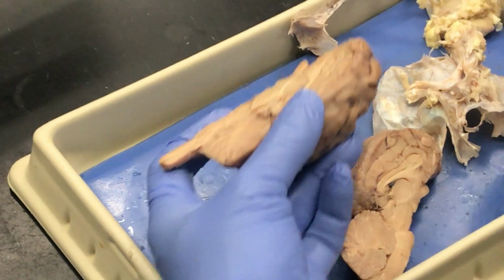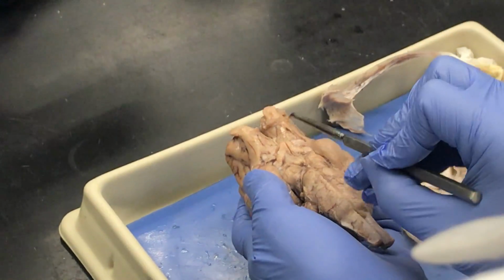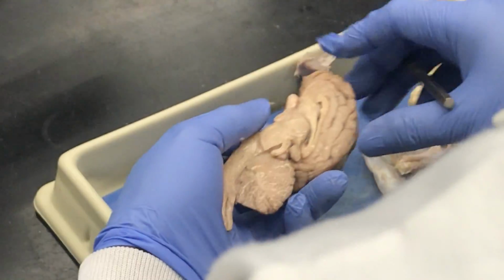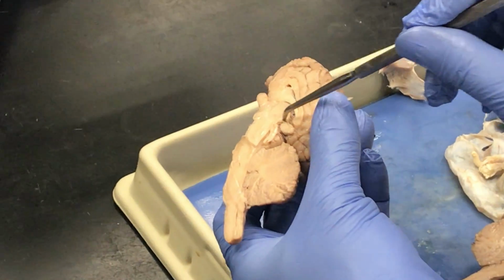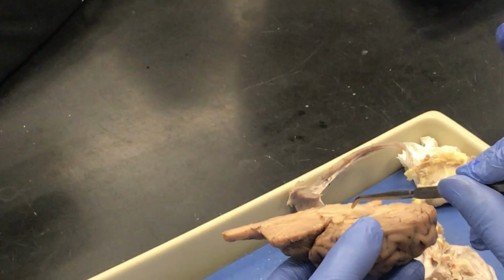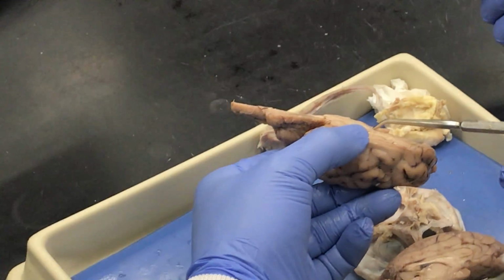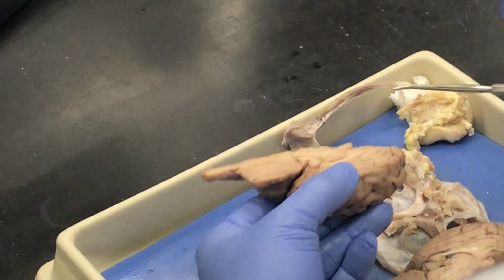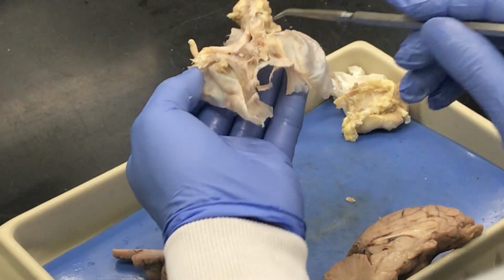Hypothalamus. So something else you could look for. Here's just the other portion of the optic chiasm. So when you split it in half, hanging off here is optic chiasm. You have the circular area of the thalamus, and hypothalamus is right between those two. Okay? So the circular area is thalamus, optic chiasm, and hypothalamus is right here between those two. The pituitary gland. Pituitary gland is right here in the center of our dura mater.